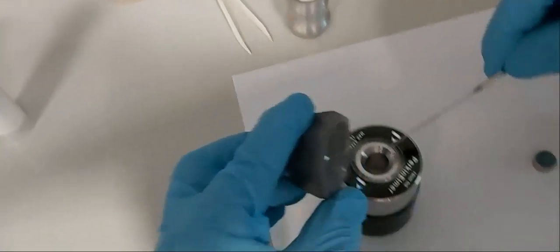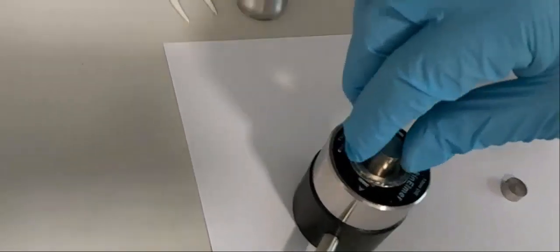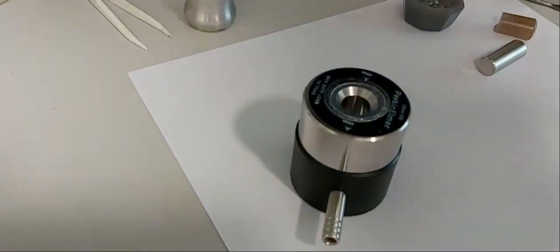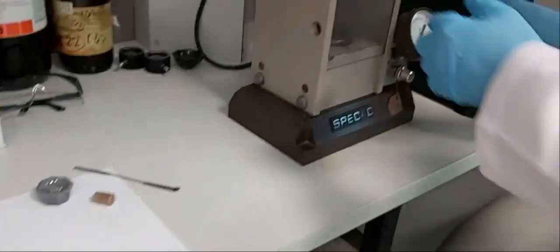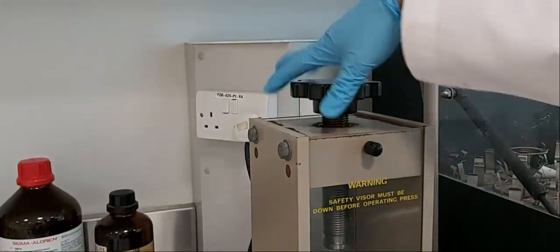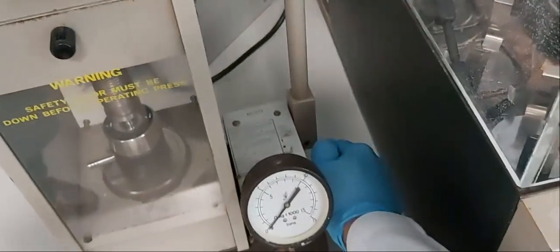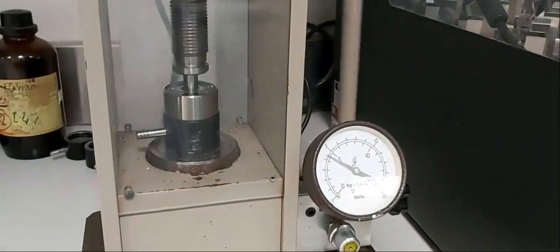We place this powder in the small press die, sandwiched between the two metal bolts. We distribute the solid evenly, place the small piece and the big one on top, then place the sample in the hydraulic press as we did before with KBr alone. We close it and apply pressure up to around 10 tons.